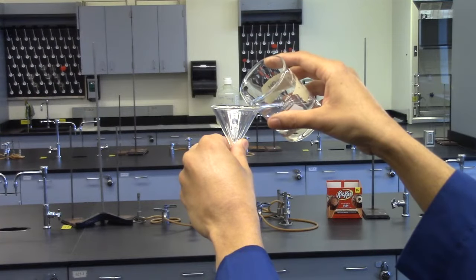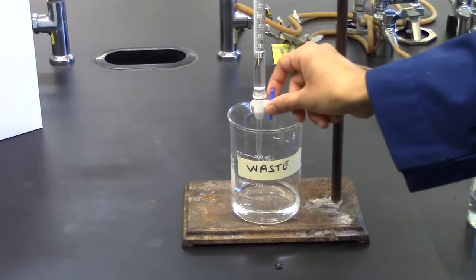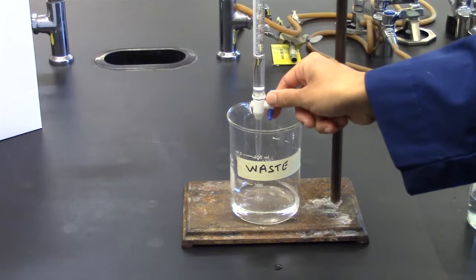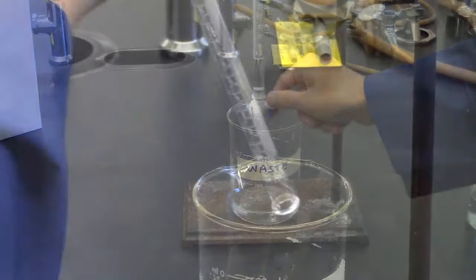Now use 3, 5 ml aliquots of your sodium hydroxide solution. Remember, you always rinse measuring devices with whatever they will be measuring.